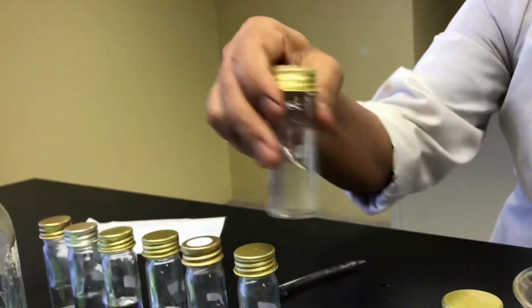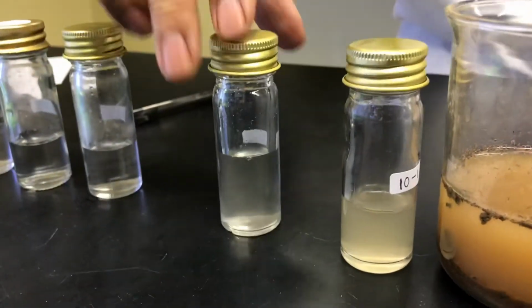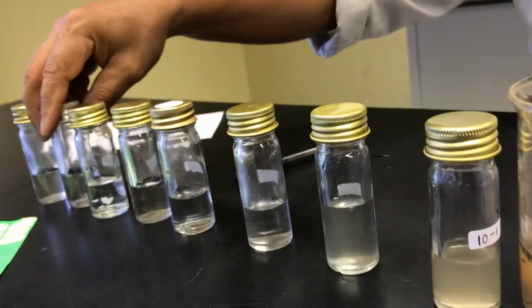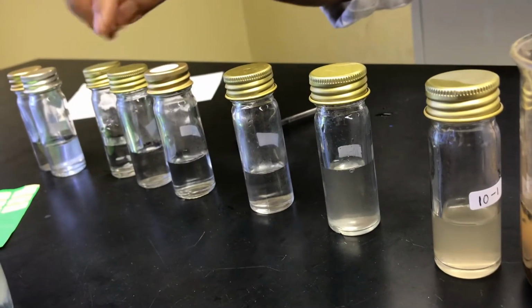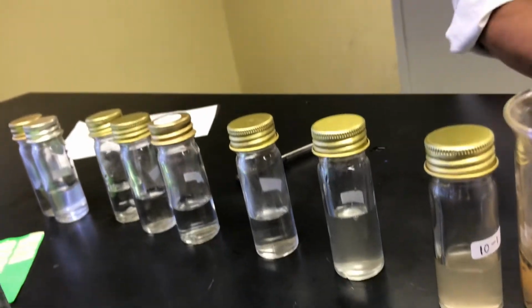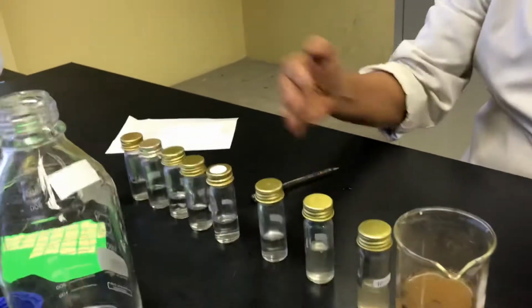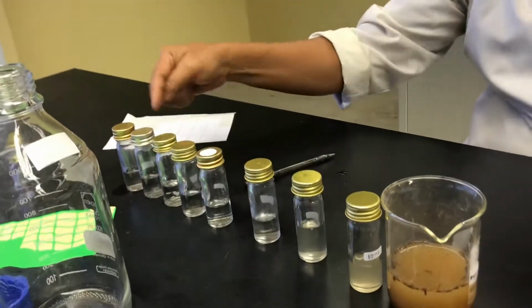And then you swirl again, and you repeat like that until you get to 4, 5, 6. You don't have to go to 7 and 8, as an indicator. If you do TSA only, you have to go to 8, but then you have to go all together. You repeat the same until you have the sample all there.